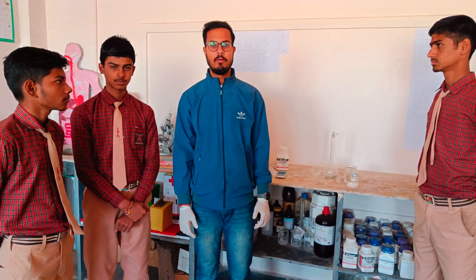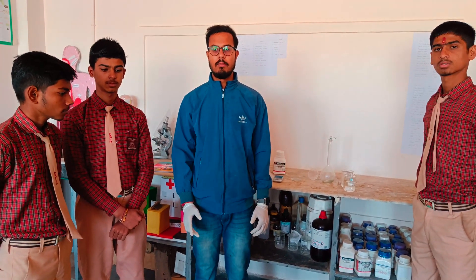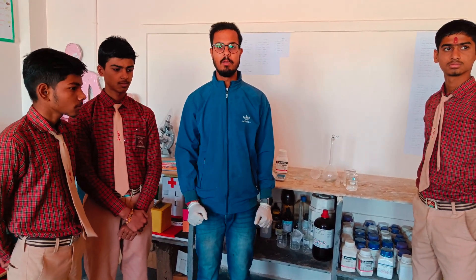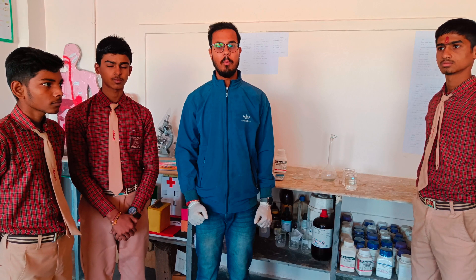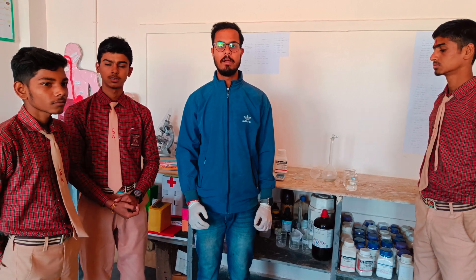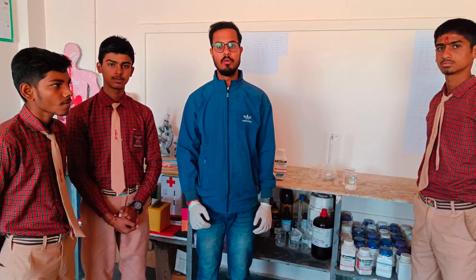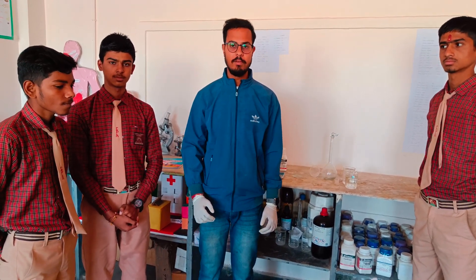Today we will perform a class 11th experiment in which we will prepare a 0.1 molar 500 ml sodium carbonate solution.